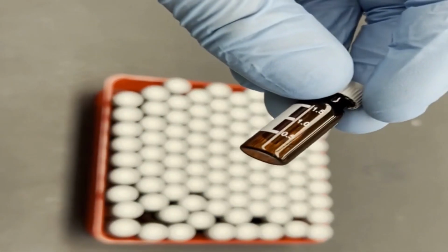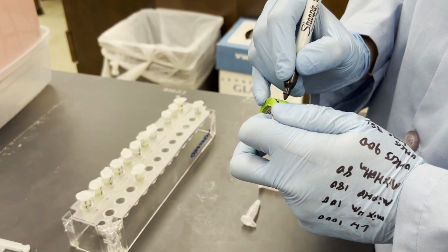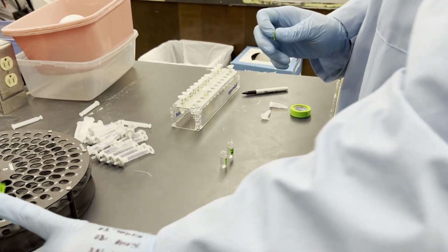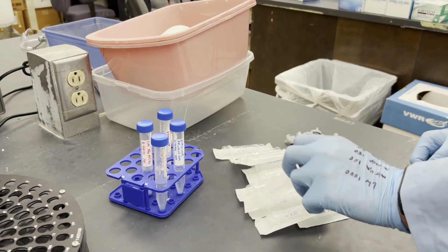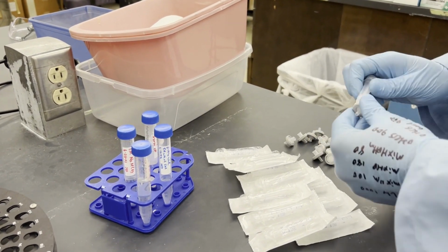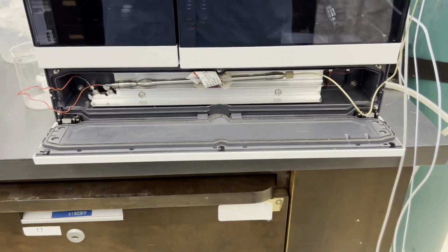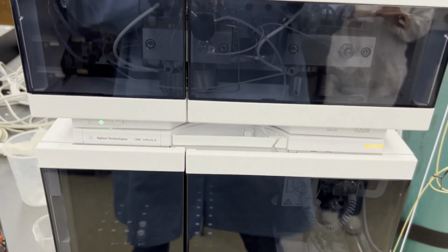We need labeled HPLC vials for each of our samples. Be sure they are clearly labeled so you know which sample is which when adding to the vials and placing into the HPLC. We will also need syringes with filters for each sample, so these can be prepared ahead of time as well. Removing the plungers ahead of time will keep you from having to fight with them while your samples are in your workspace. Your HPLC will need purging and equilibration before your run, so now is a good time to get those started.